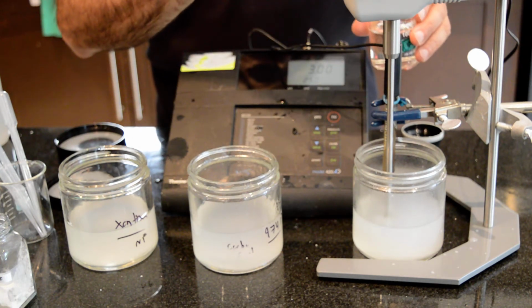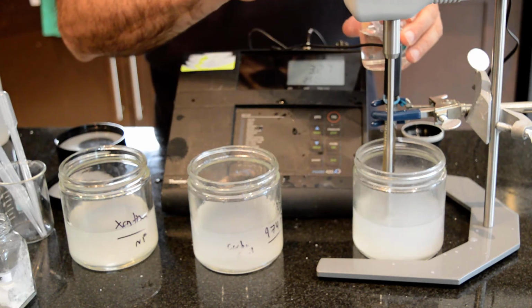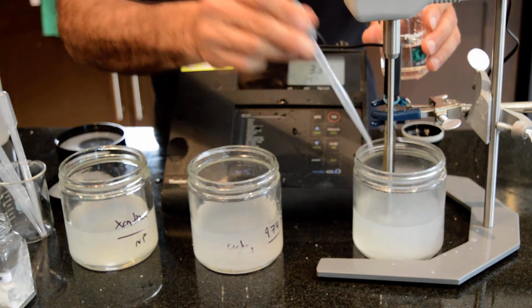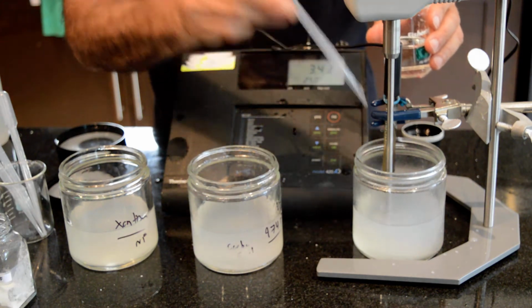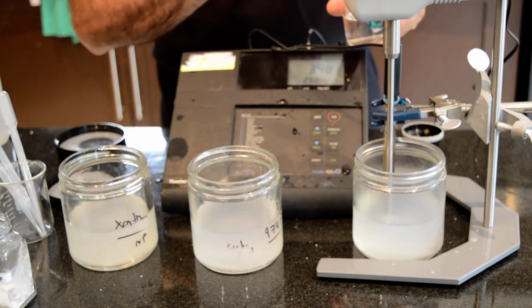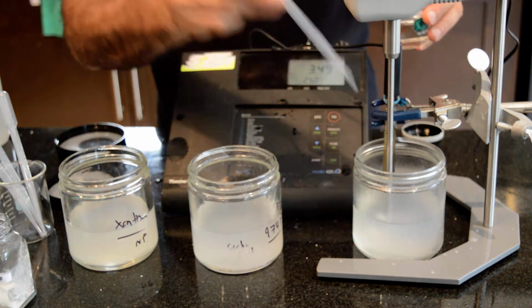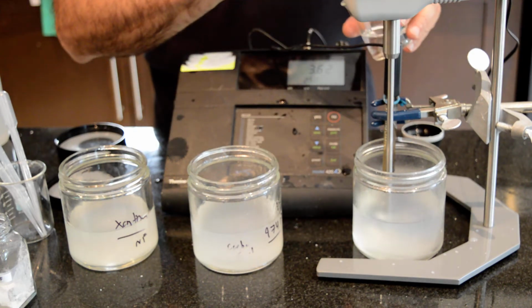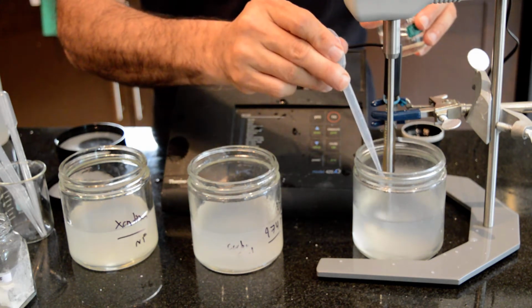I can tell that for the pH adjustment, probably one normal sodium hydroxide would have been a better pH adjuster, because if I add too much sodium hydroxide, I'm not going to have the 1% solution anymore. But anyway, for the demonstration, that should be okay. As I'm adding the sodium hydroxide, my pH value is increasing, and it also seems like the alginic acid is becoming more clear. It's not cloudy anymore. So I would suspect that the alginic acid is going to give me a clear gel. If people want to develop a product with a clear gel, it seems like alginic acid is their choice.